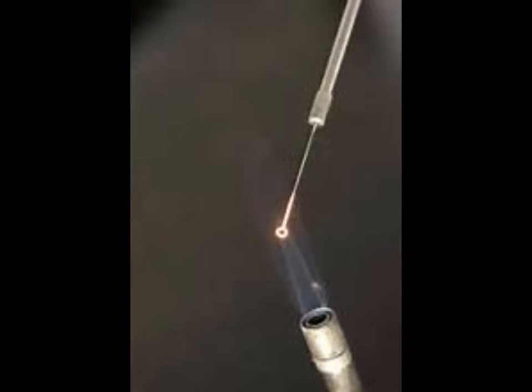Before we begin working with our live bacteria, we want to take our flame loop and hold it over a flame source, a heat source, and sterilize the flame loop.